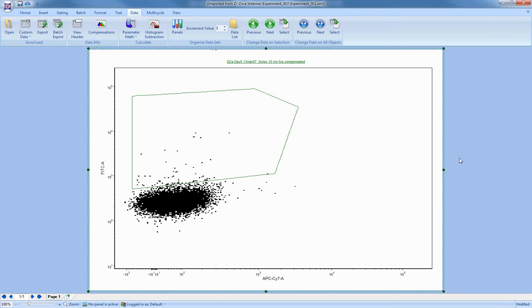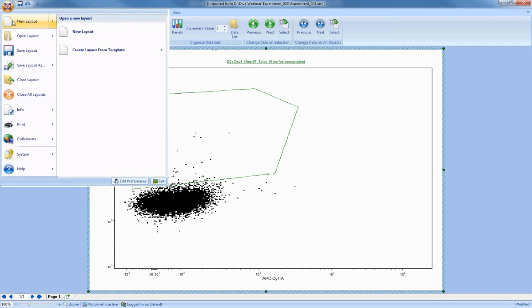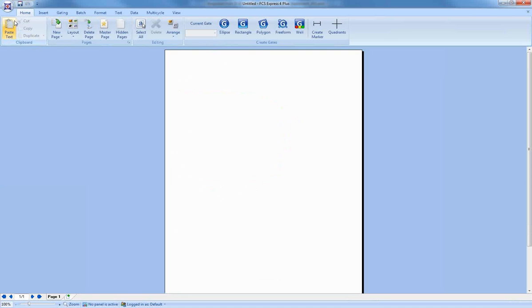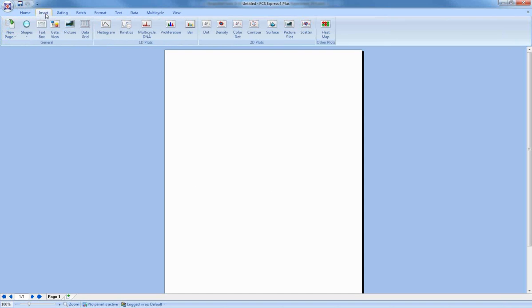Okay, so does anyone have questions about the importer? I'm going to move on to show a little bit about using data files directly. So instead of using one of these layouts, I'll make a new layout. In FCS Express, when you create a new layout, you get what looks like a blank page. Let's start by inserting a color dot plot on here.